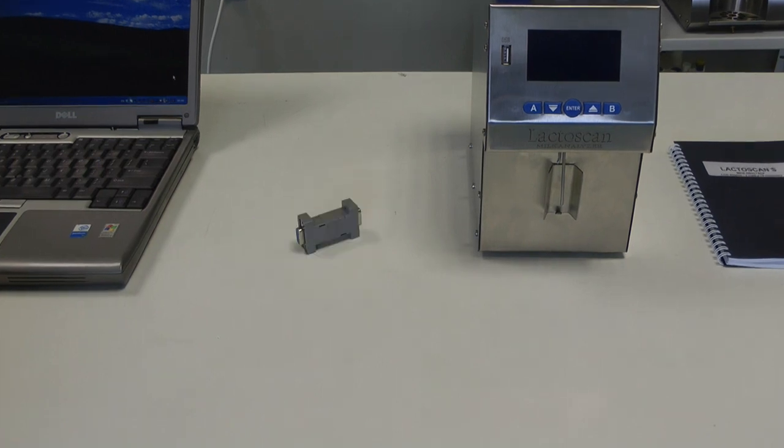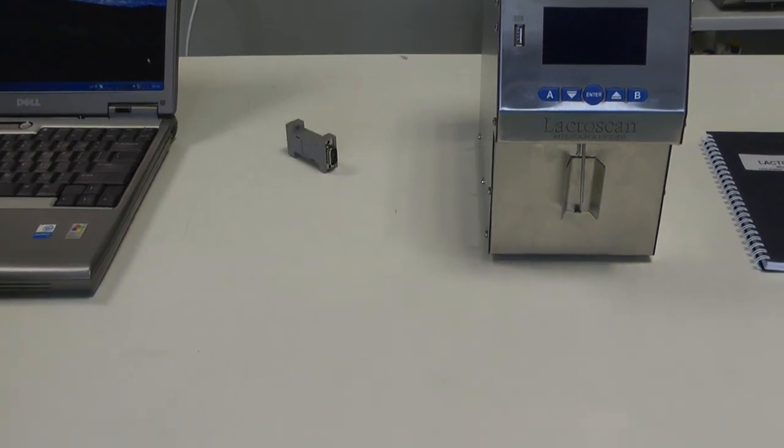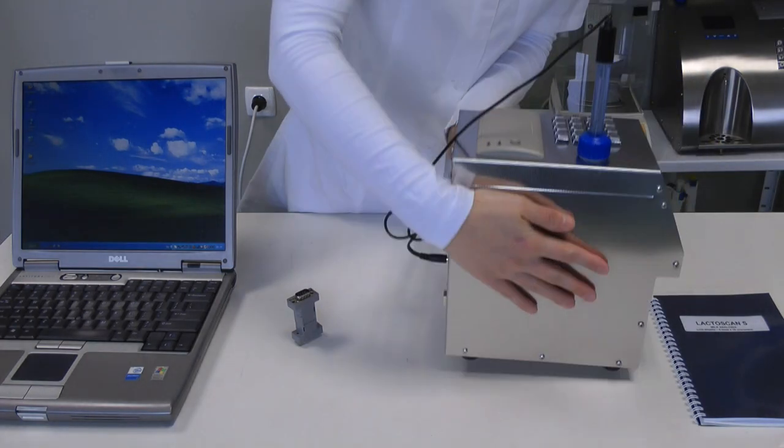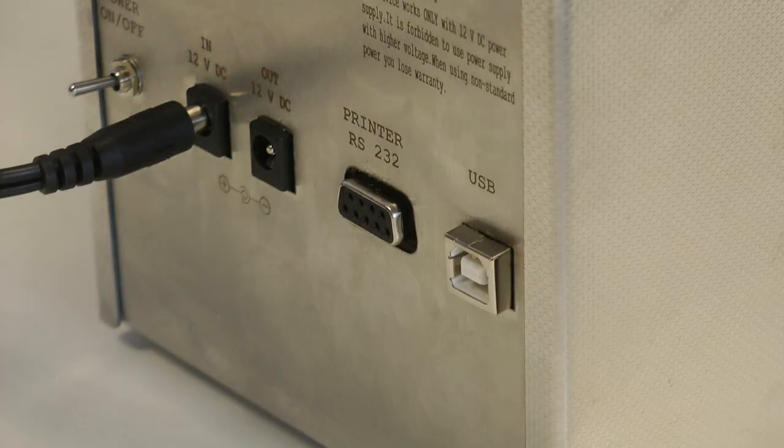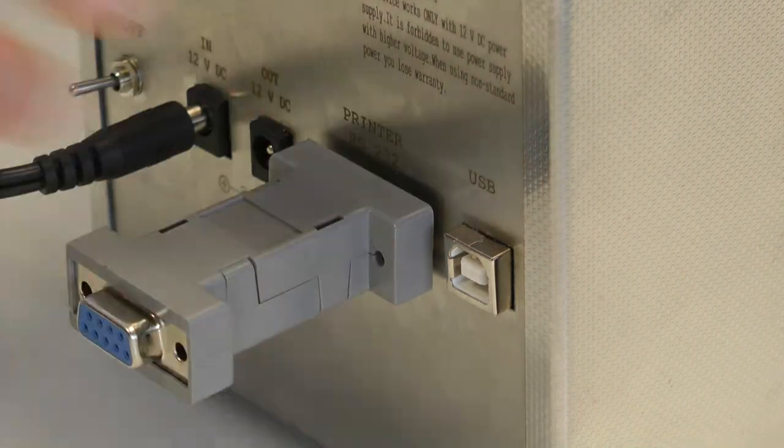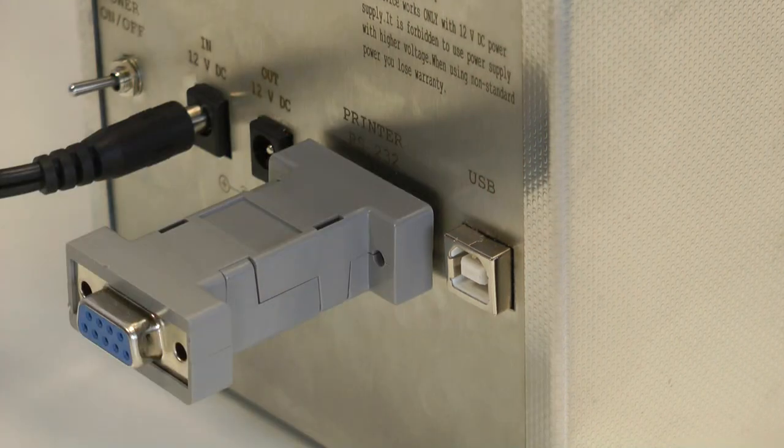Bluetooth connected to the rear panel in the RS232 interface. For this purpose, you have to switch on the Bluetooth on your computer, find the analyzer, and enter the numbers 1234.